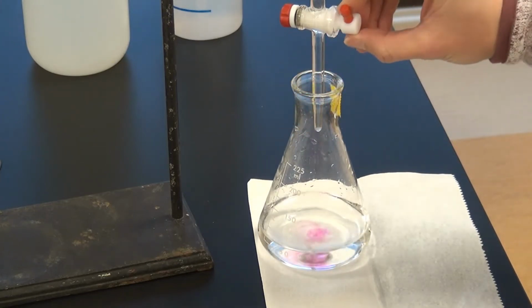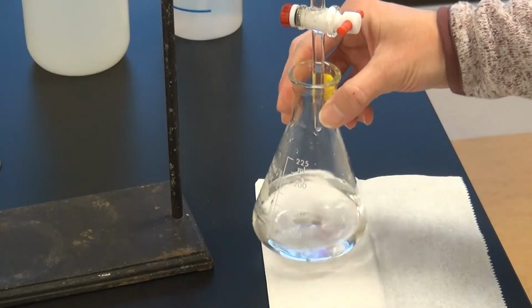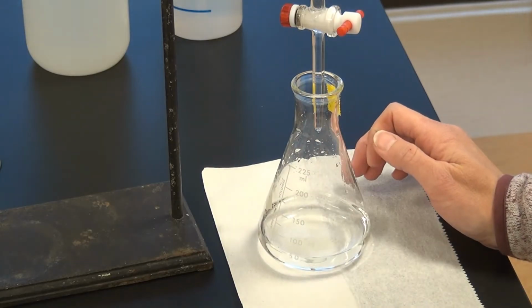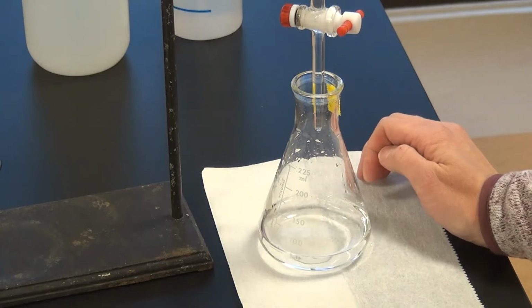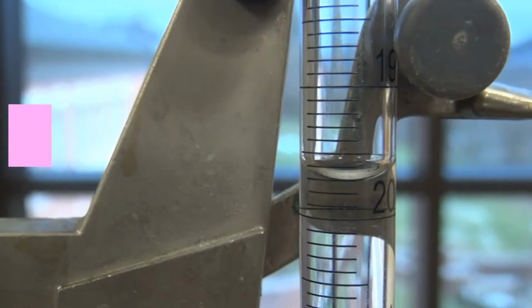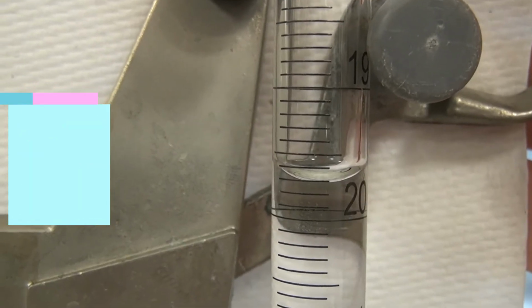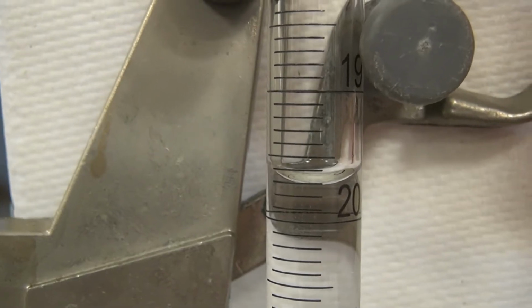Okay, I'm going to stop it here. And we're going to zoom in now. We are a little over 19.5 mils right now, not quite at 20 mils. And we'll go ahead and do our zoom in. Okay, so now we're going to do drop by drop. So we're going to record the volume each drop we take, so we can catch that actual equivalence point.